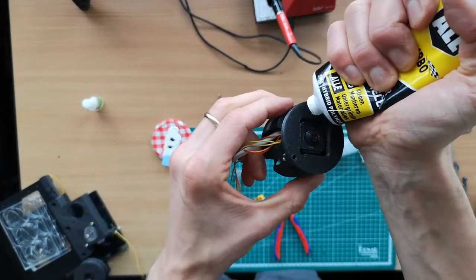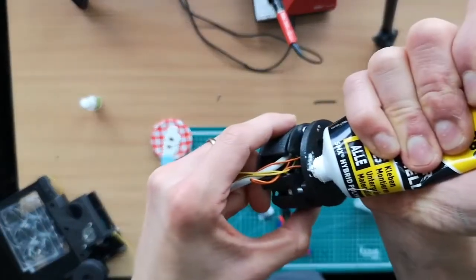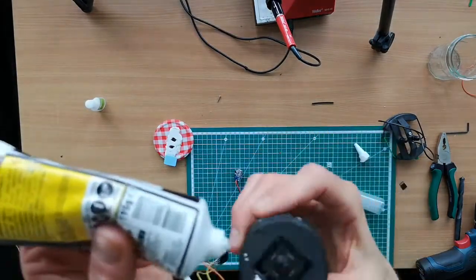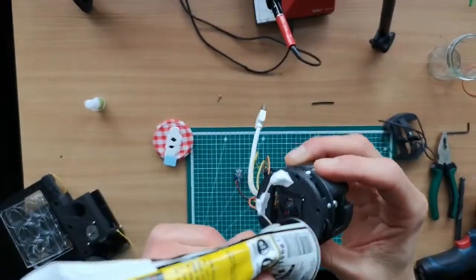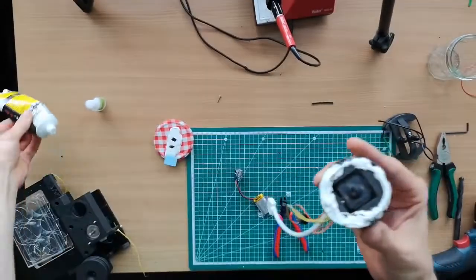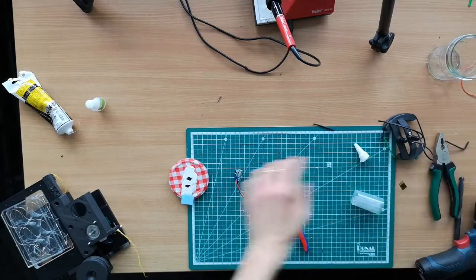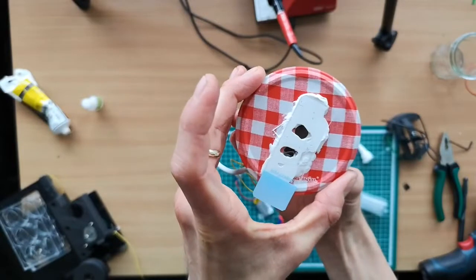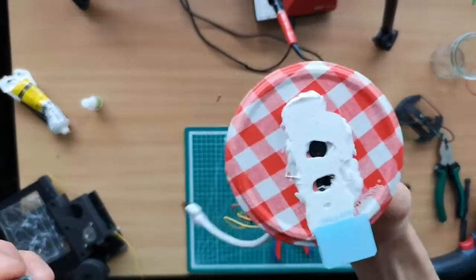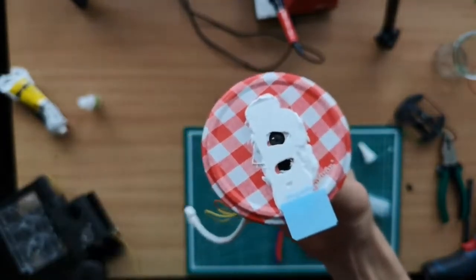And we again add some glue. So again, you add some glue, and make sure the light can go through. And then carefully mount it that way, so that the lens is pointing here. So you see the lens here, and the LED will come through this point here. And that's it. You are done.